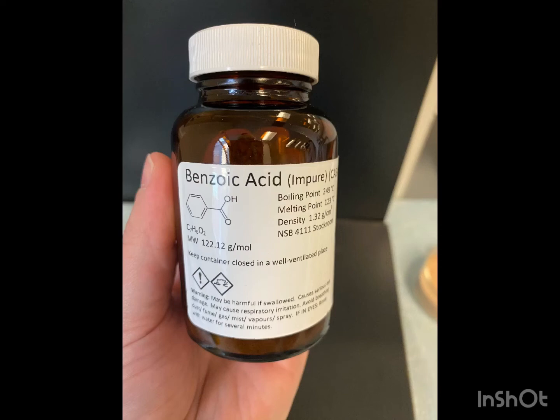Hello, my name is Krista Riggins and today we are going to recrystallize benzoic acid with water. Recrystallization is a very vital and effective method of purifying organic solids.